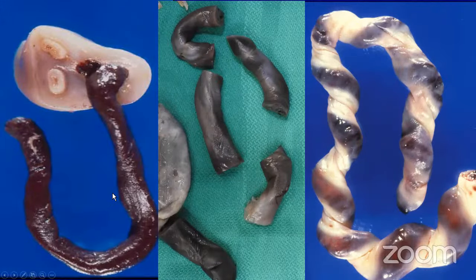This very bland postmortem acute deciduitis or chorionitis — these two images would have been from stillbirths that likely occurred days before delivery, hence the neutrophil karyorrhexis. You can use that kind of timeframe to compare with other pieces of information about the interval between demise and delivery, such as the extent of external skin slippage or maceration.